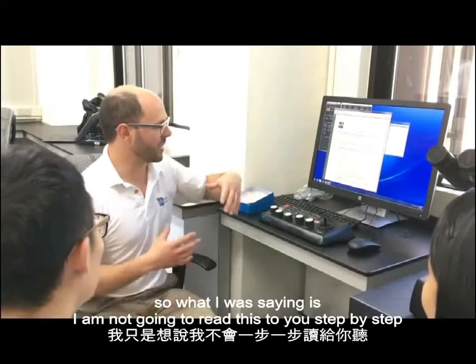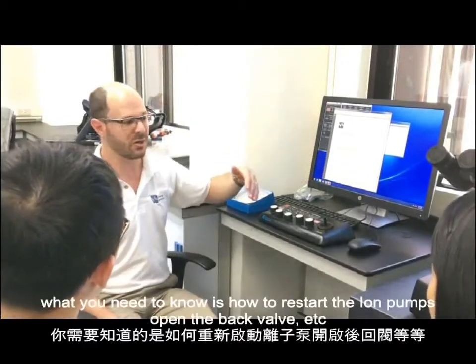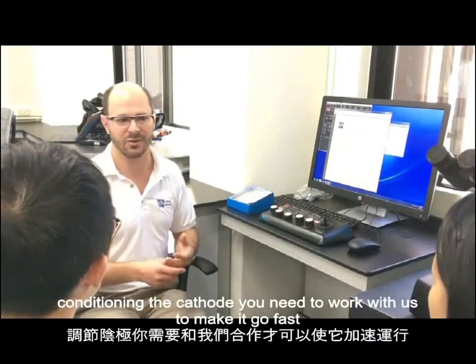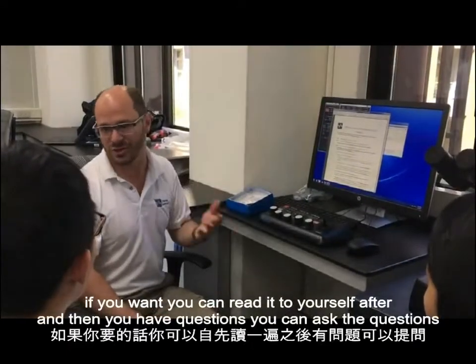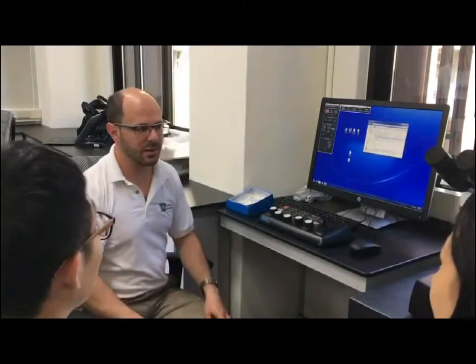Okay. So what I was saying is I'm not going to read this to you step by step because the detail isn't important. What you need to know is how to restart the ion pumps, open the back valve, etc. And that the next step is conditioning the cathode. And for conditioning the cathode, you need to work with us to make it go fast. If you want, you can read it yourself after, and if you have questions, I can answer them. The most common thing for degassing?